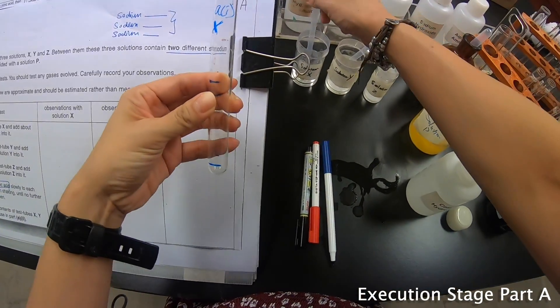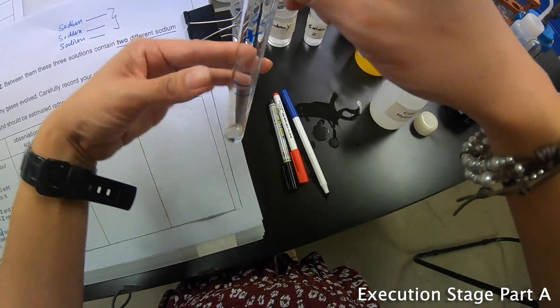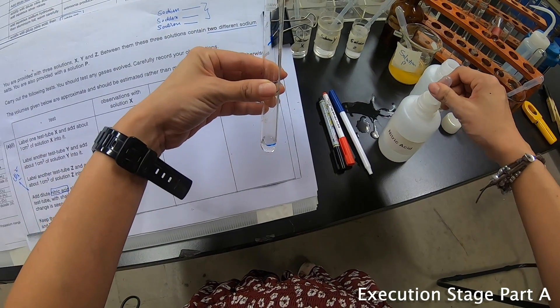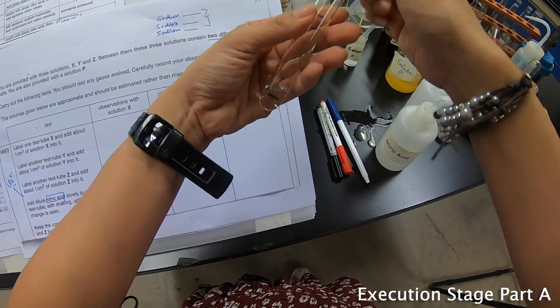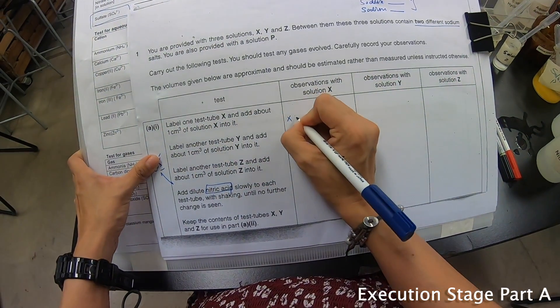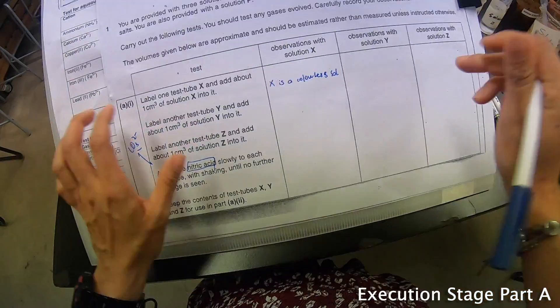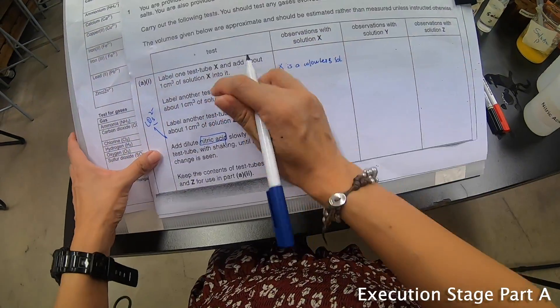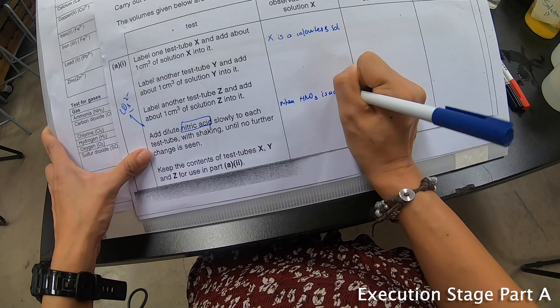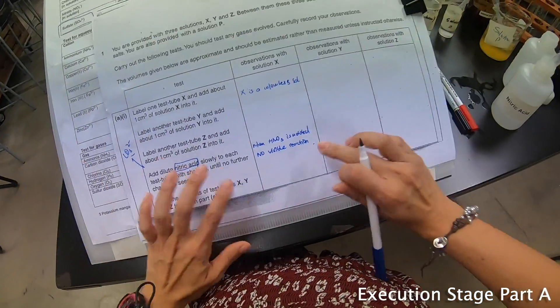This is X — 1 cm³ of X — and then nitric acid. There's no visible reaction. X is a colorless solution. When HNO3 is added, there is no visible reaction.